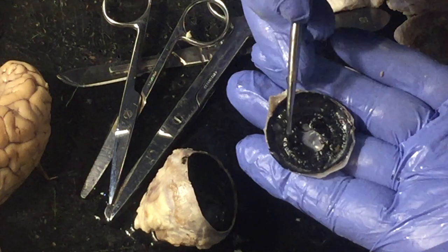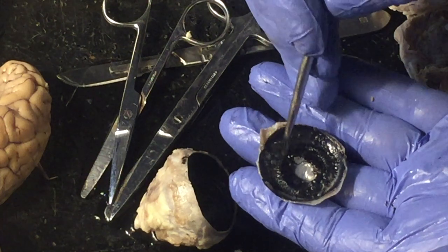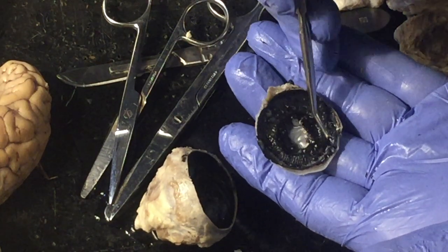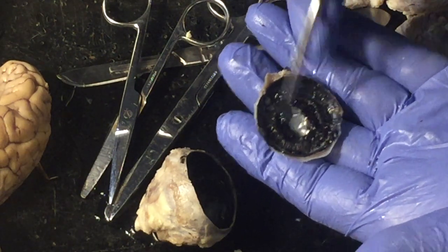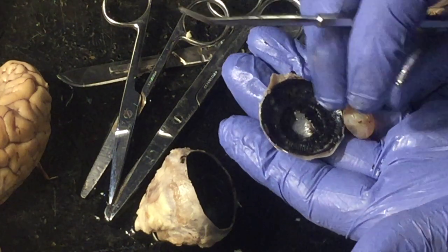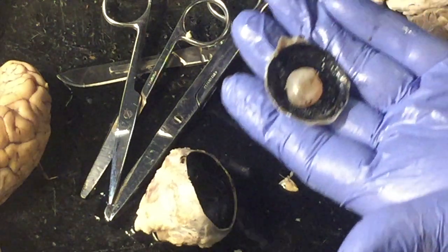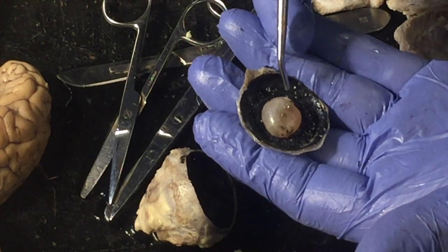And I don't know, Beck, you'll have to say, can you guys see these, there's some lines here on this outside part? Maybe a little. How about here? How about down here? Can you see them if I do that? Yeah. Okay. Those are radial muscles. So in the iris, there are circular muscles, but out here in what's called the ciliary body are radial muscles, and they actually attach right here around the edge of the lens. Okay, so the lens would sit in there. Those muscles would attach to the lens, and they're going to tug and pull on the lens.